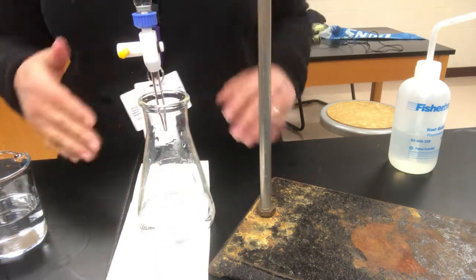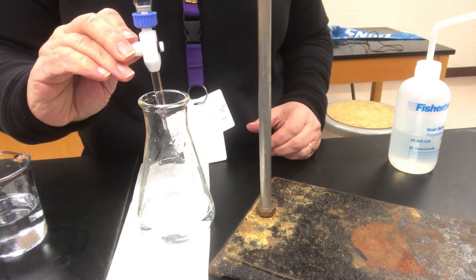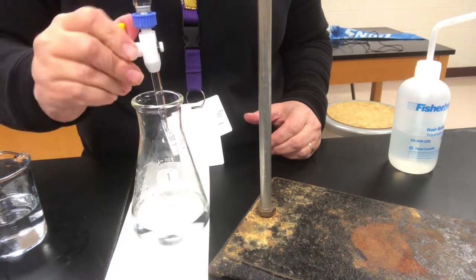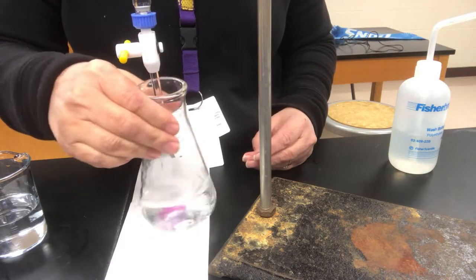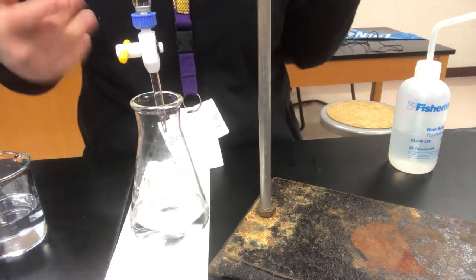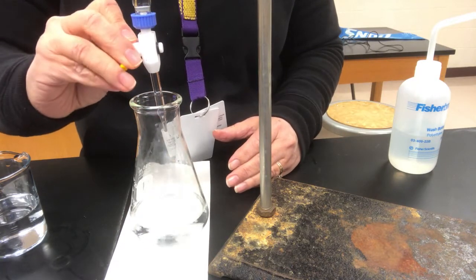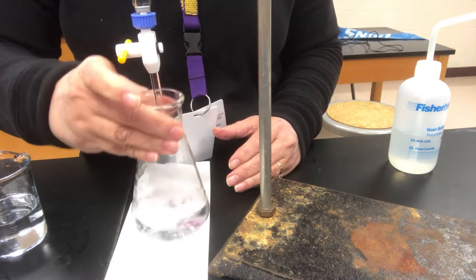So we know it lingered pretty good, so we know we might be pretty close. So I'm going to be a little bit careful and just be tentative and see how quickly it disperses. It's hanging around a little bit, so I'm not going to add the big generous squirts that I did in the earlier titration, and just go a little bit more tentative. Little smaller squirts. Probably going to start transitioning into drops. Yeah, that's hanging around a little bit. So I'm going to transition into just doing this drop-wise. Instead of squirts, we're adding drops. So to add drops, I'll just rock it forward a little bit and then back. One or two drops at a time.